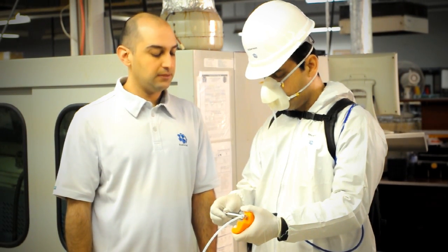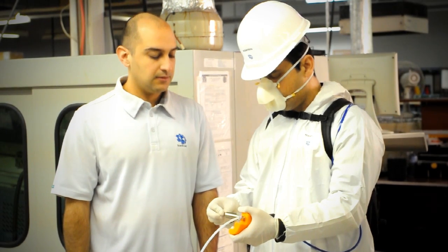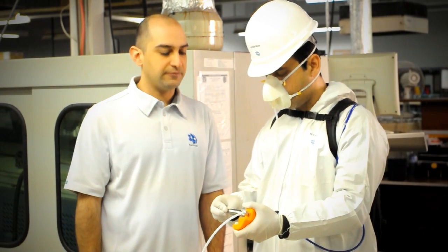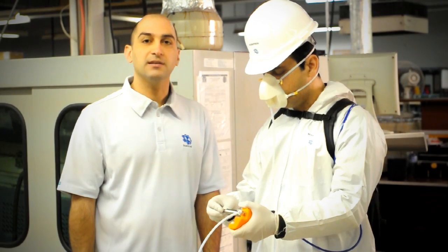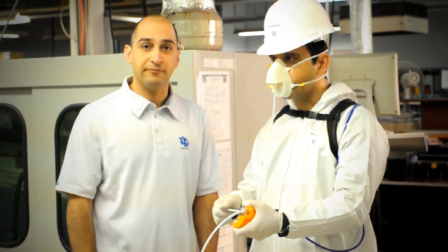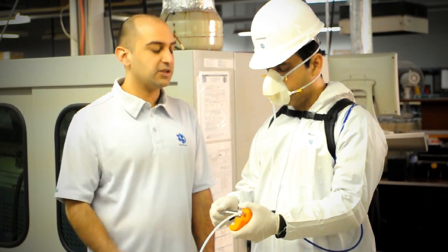Now at step three. Now at step four. Okay so he smells the odor around step four. So you can shut off the valve now.